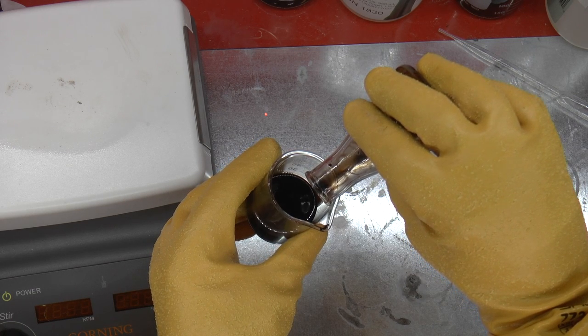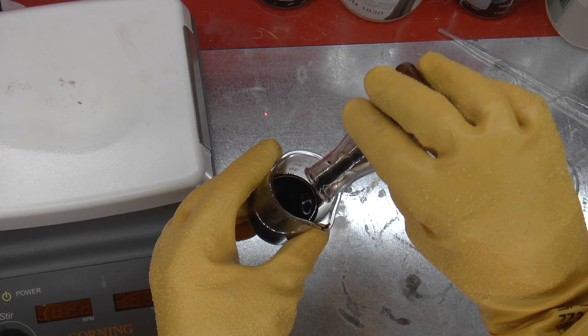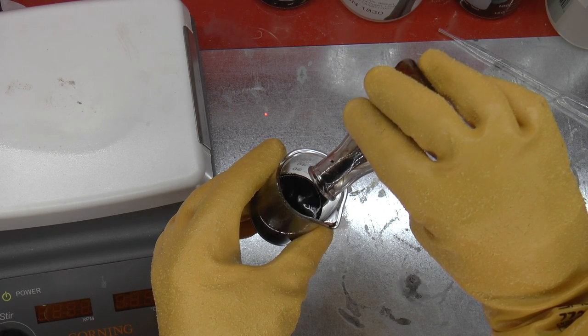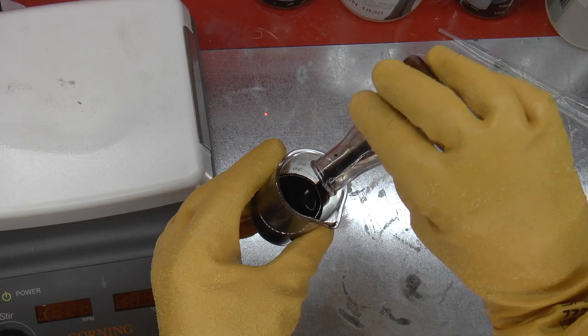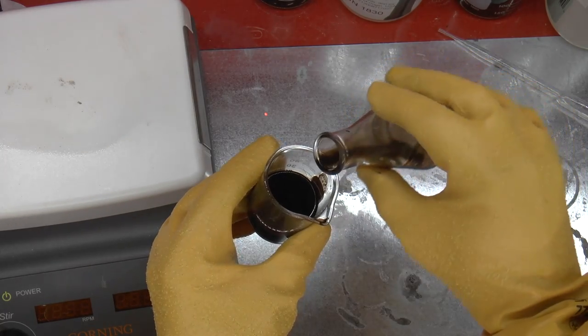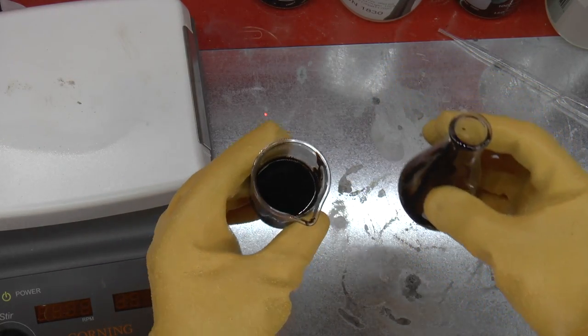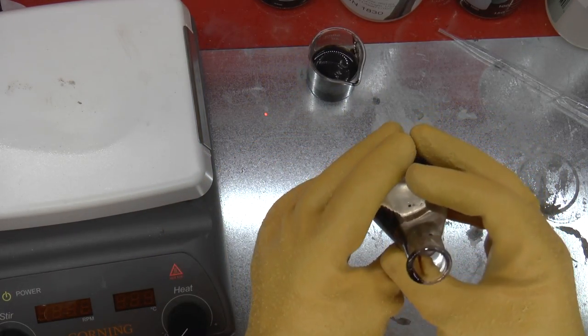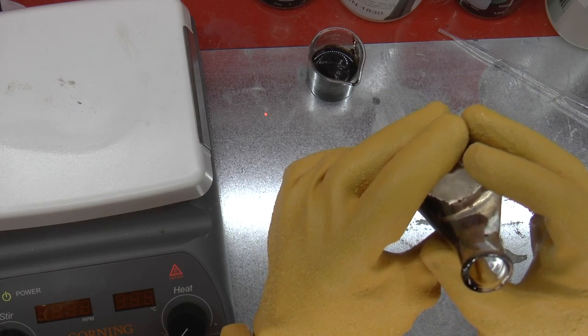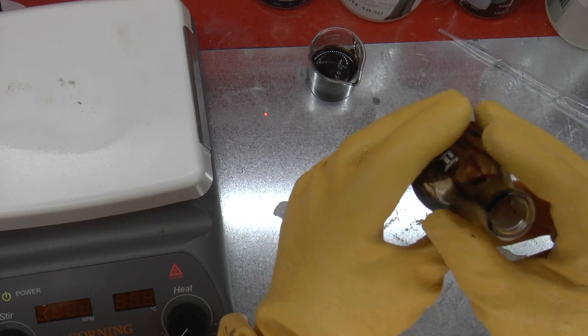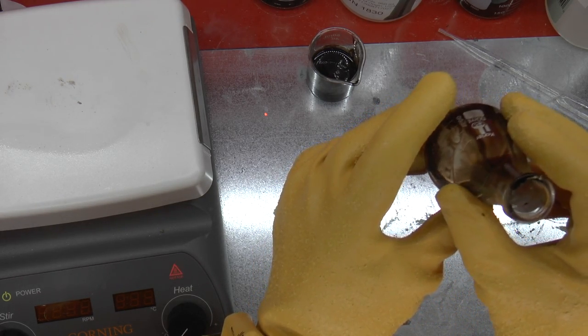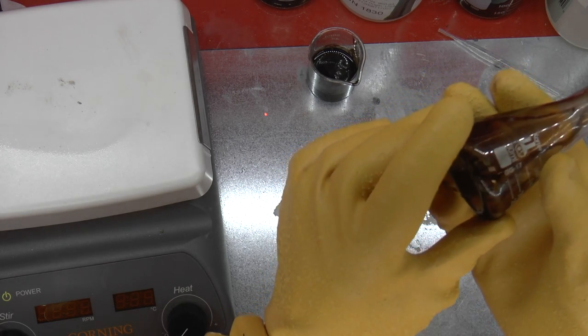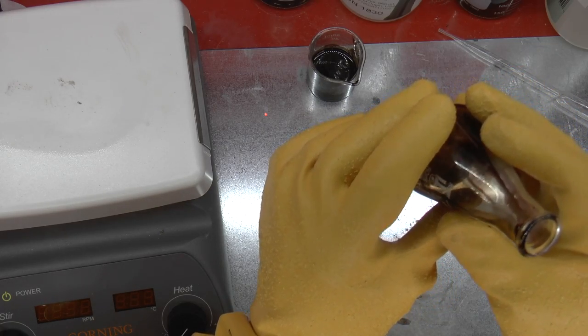Taking a look, we're going to see maybe what's inside. I'm going to set that aside. That's used acid that I can use later, maybe for distilling. I'm looking inside the beaker, and right now I get a sort of sinking sense of disappointment because I actually see the chip in there, and not much has happened to it.